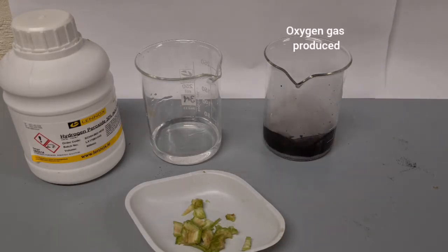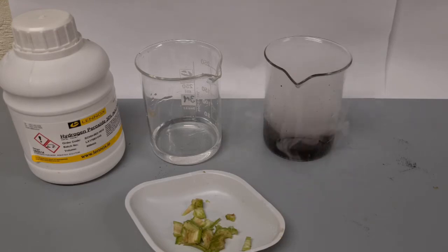We can see that it speeds up that chemical reaction. It speeds up the breakdown of hydrogen peroxide. The gas being produced is oxygen gas.